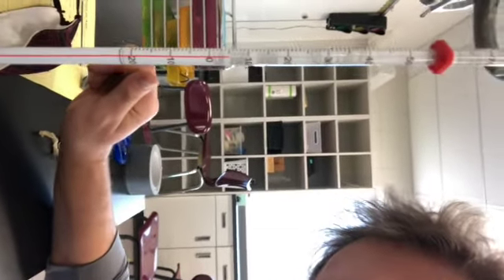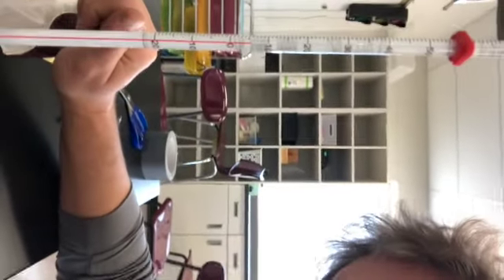All right, now we're at 5 minutes, and let's see what's happening. You can see that the snow is now turning to water. But let's see what our temperature is. You'd think that heat would make it higher, but it's really not any higher, is it? It's still about 5 degrees, so we only went up 3 degrees in that first 5 minutes. Let's try the next 5.